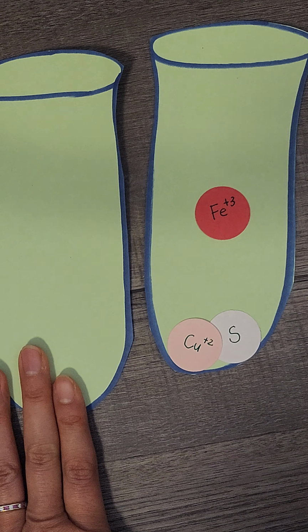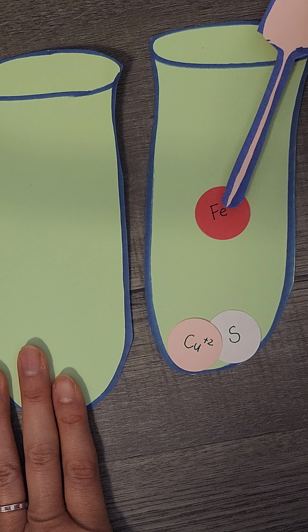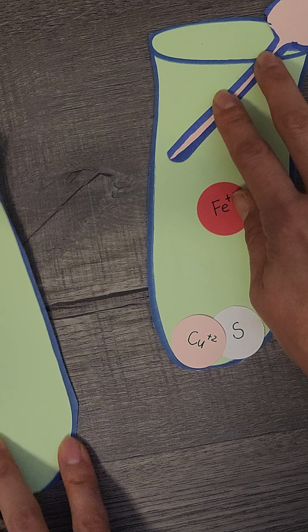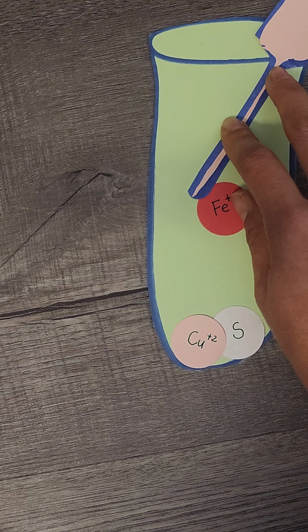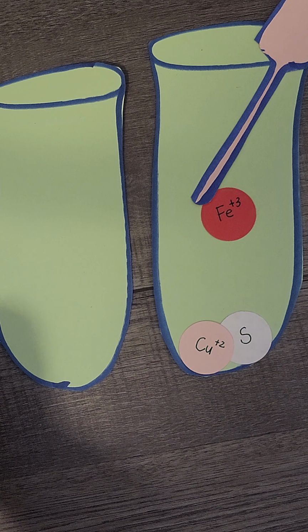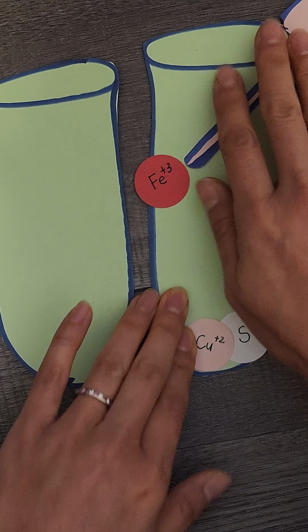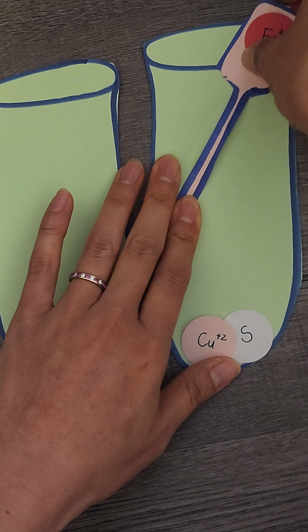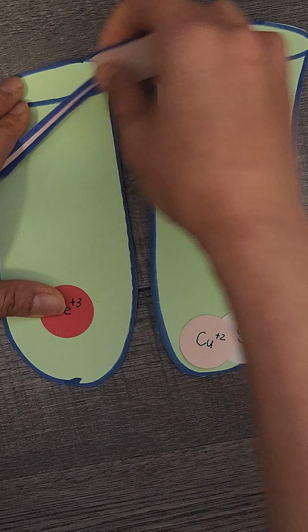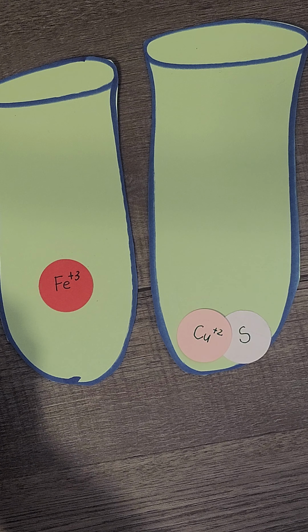Then you take a pipette and take out the supernatant, because this is the supernatant and this is your precipitate. You take out the supernatant and put it in a clean test tube. Here's another clean one, and probably you want to label this. You take it out with the pipette and squeeze it back into a clean test tube here. So that's my supernatant. Here's copper sulfide. That should be your pellet, or your precipitate.